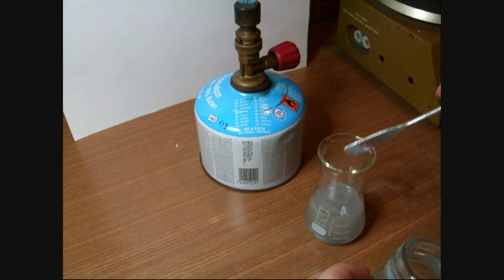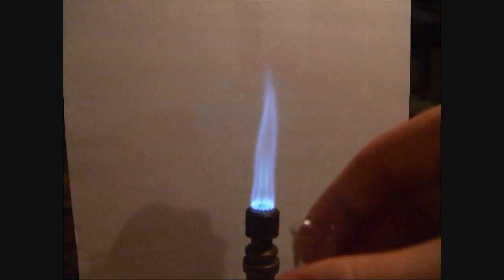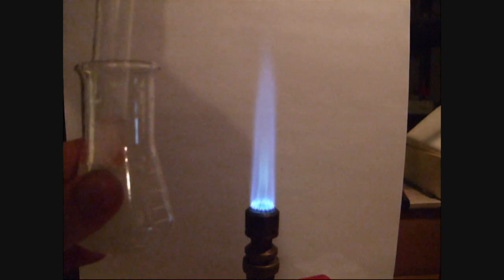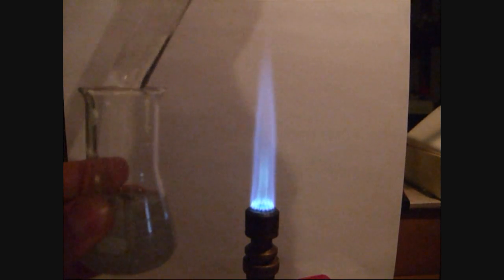While the reaction takes place, a test tube with some ice water is prepared and held into the solution, so a small quantity of the solution covers the cold surface of the test tube.